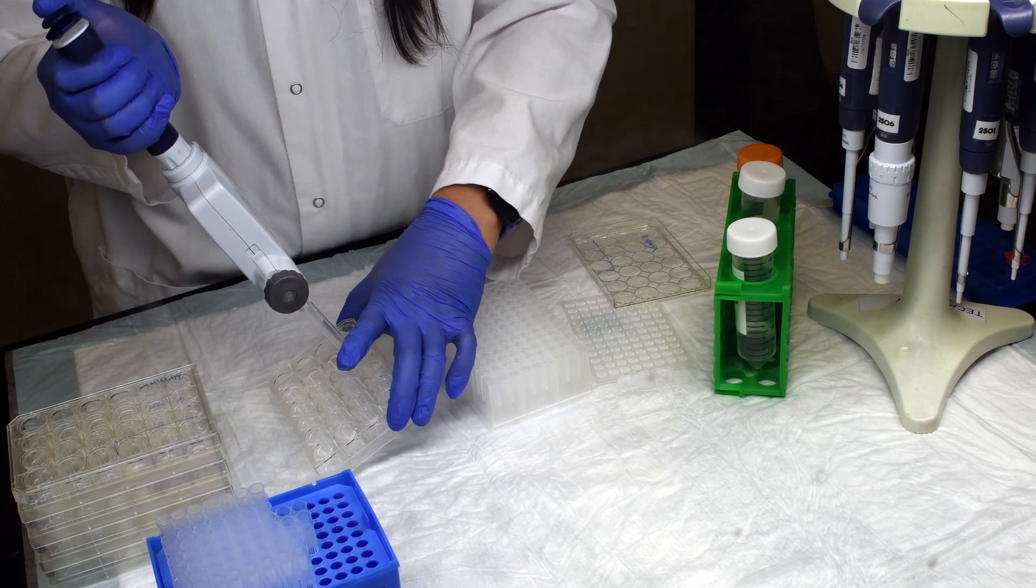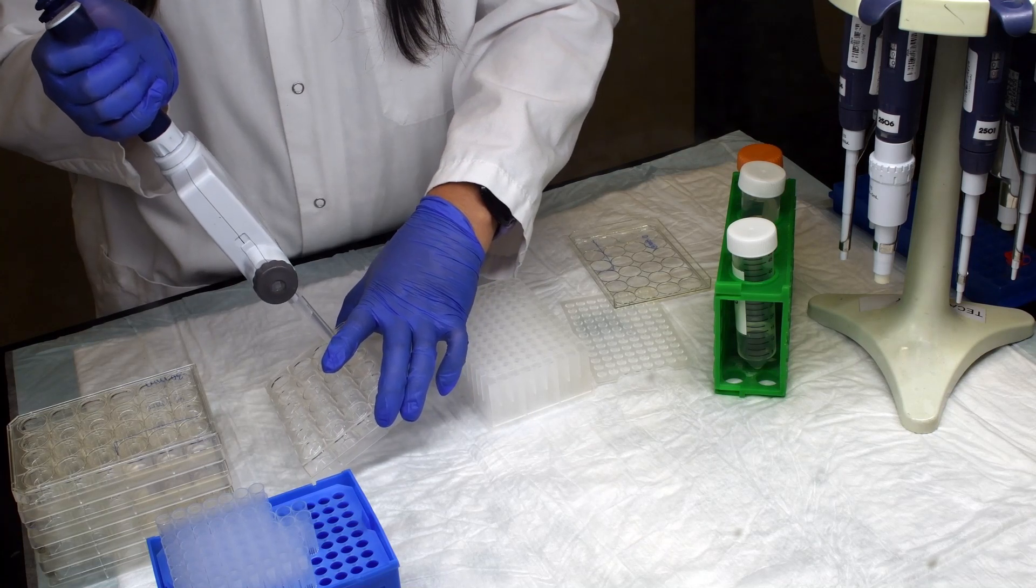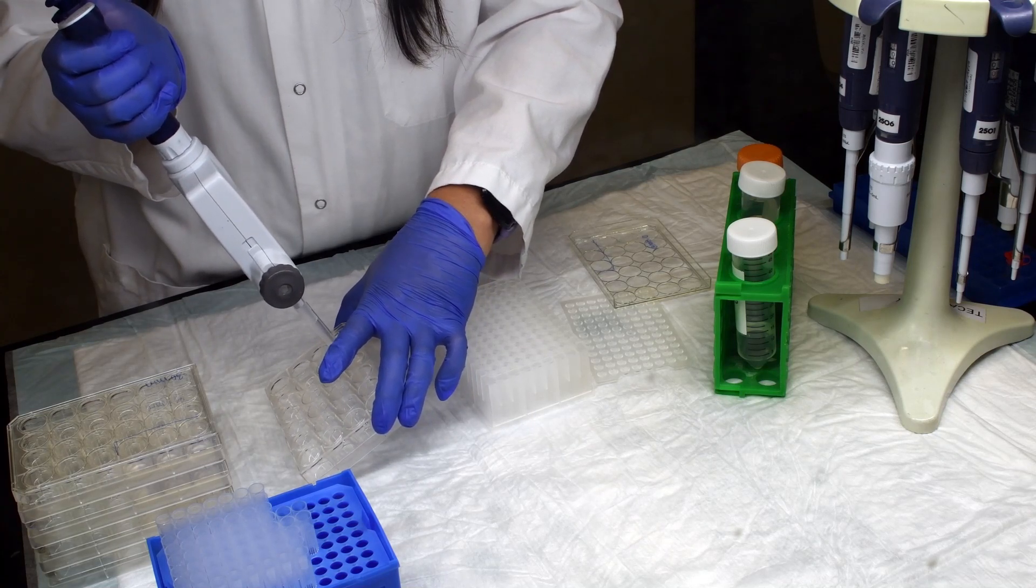Transfer the contents of the crashed wells into a deep well mass spec plate or storage container that is commonly used in your lab.